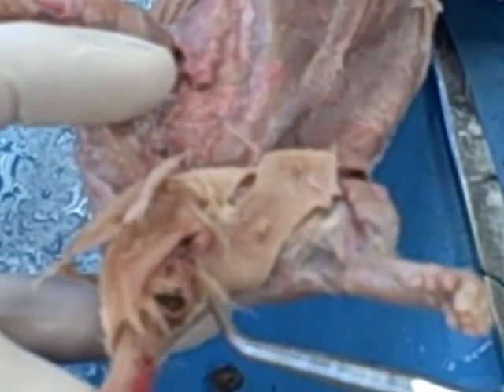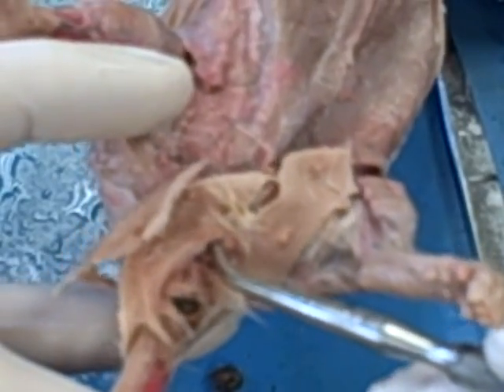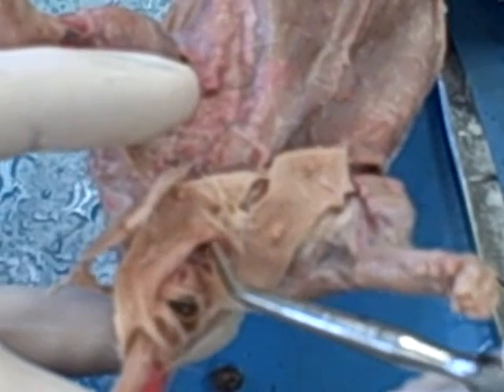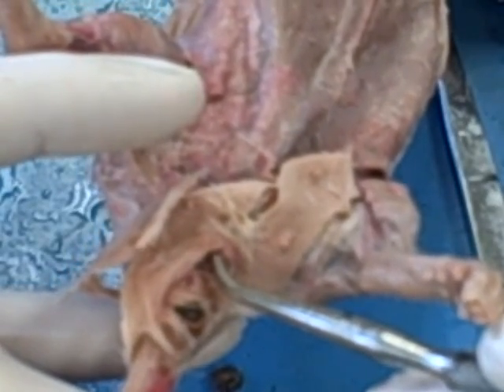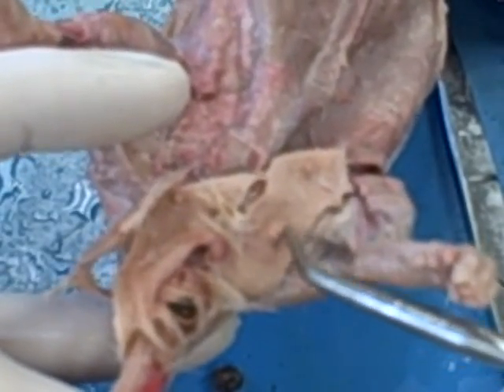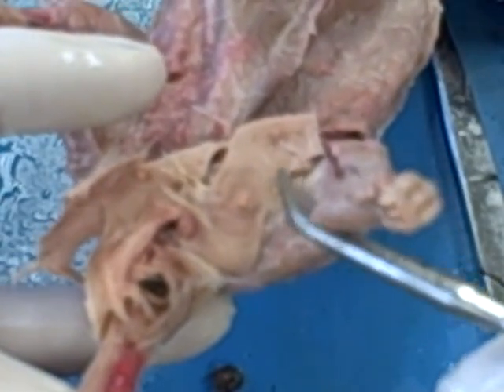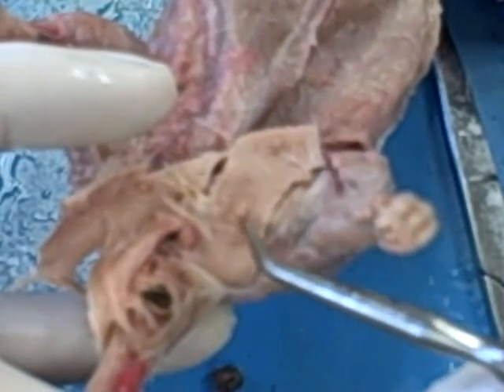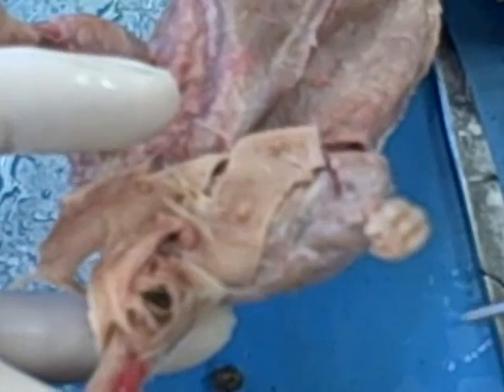The female has two other structures, actually three other structures that I want you to know. The larger opening just between the anus and the urethral opening, which is this little bump, is the vaginal orifice. Beyond that, you can see on her there are these little bumps. Of course, if a rat is fully skinned, you will not see these. These are the mammillary papillae, or nipples. Know the term mammillary papillae, though.